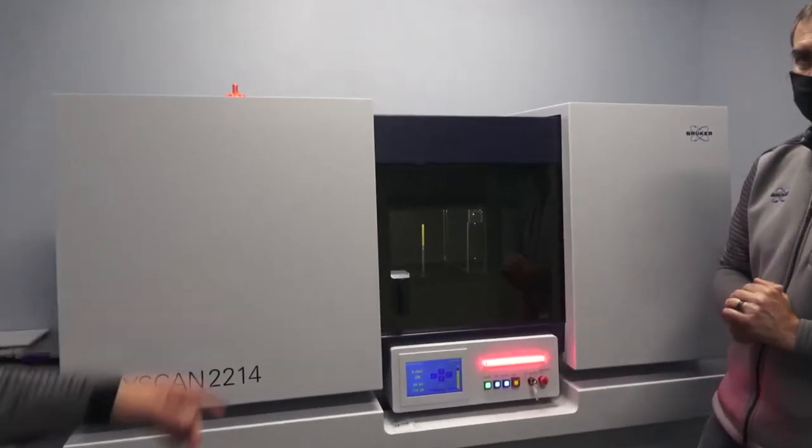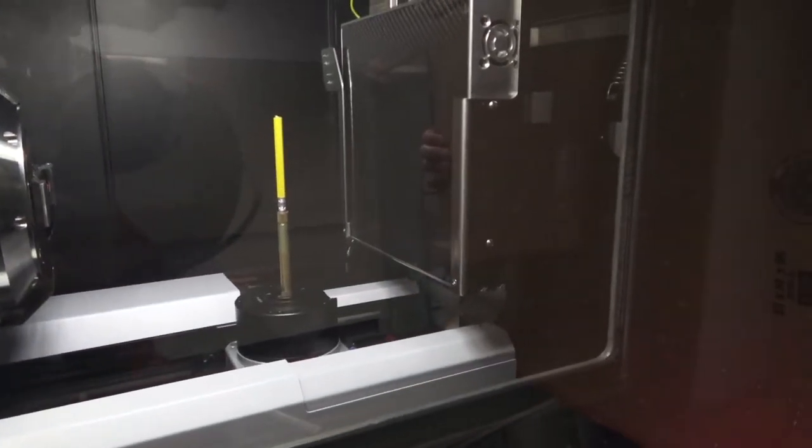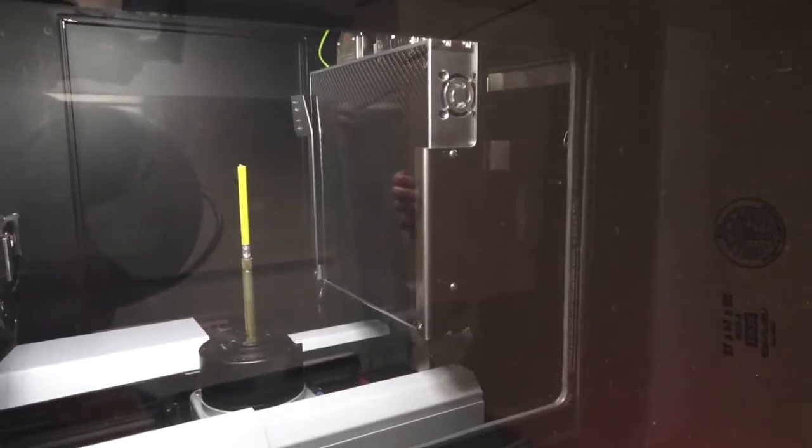If we get a little closer, we can see the detector change. Here we have a flat panel — that's the one used for most coverage. If we change to one of the others, we just click a button in the software. It kind of moves like a garage door — it pivots up out of the way, and then the detector you choose rotates into position, all pre-aligned.